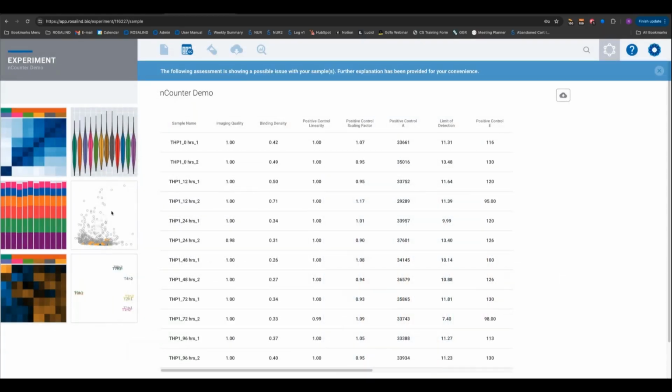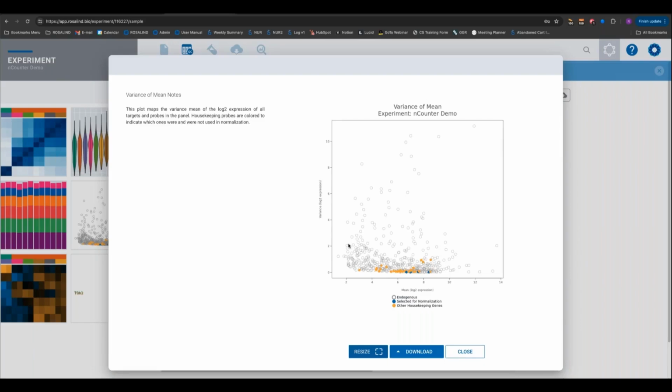We have this variance of mean plots, which is showing you essentially the performance of your housekeeper genes. You can certainly ask more questions about this, but it's basically showing you that the genes used in normalization, shown here in blue, have quite low variance relative to the other potential housekeepers shown in orange.